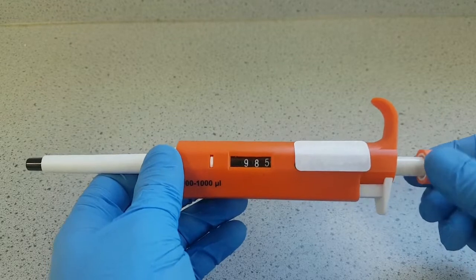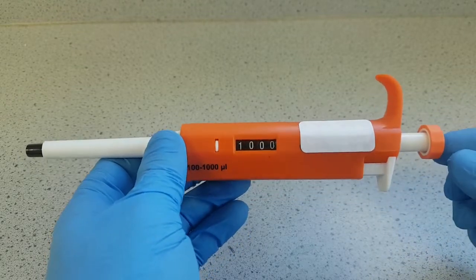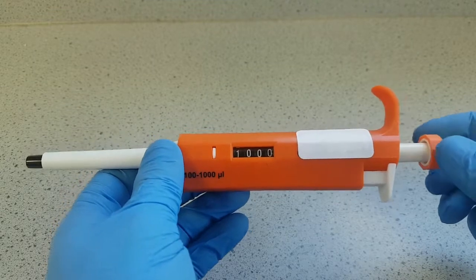When doing this, make sure you don't exceed the maximum or go below the minimum, and make sure that you turn the wheel relatively slowly.